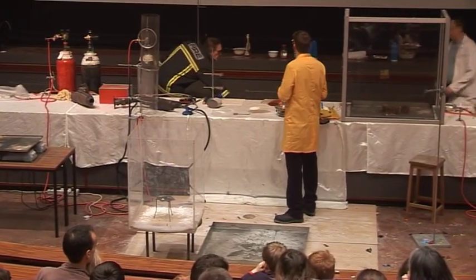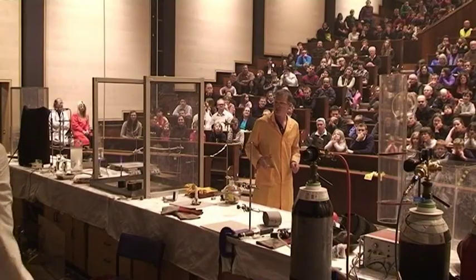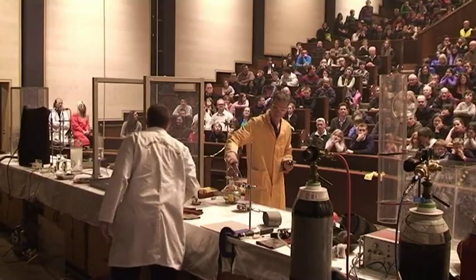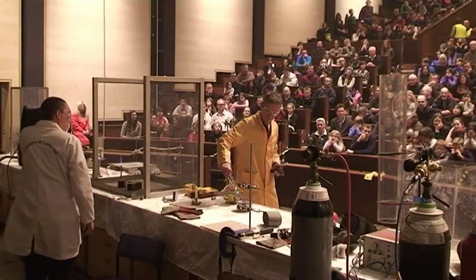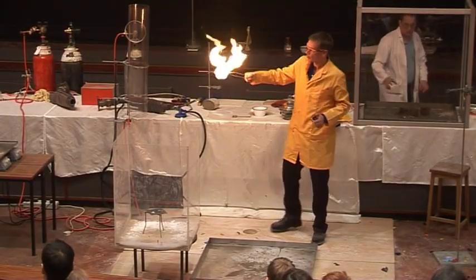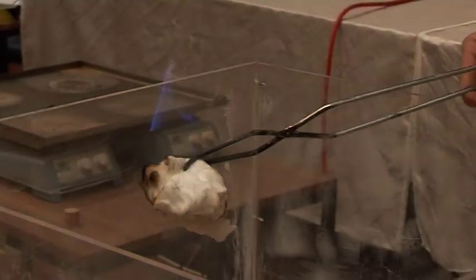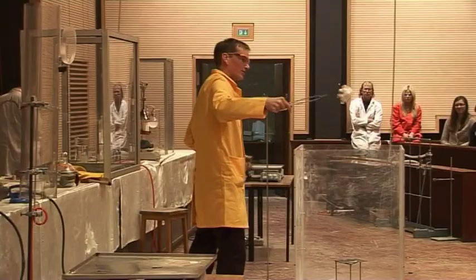I'm going to put into this some petrol — some cotton wool soaked in petrol — and it should be able to put it out. So here we are, burning petrol into the carbon dioxide. And it's gone out.